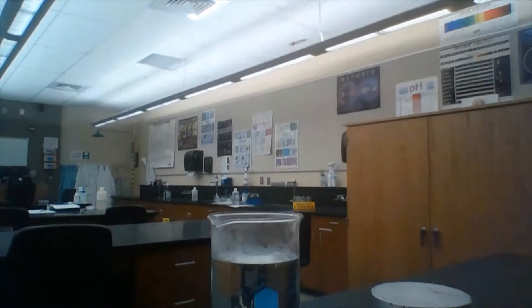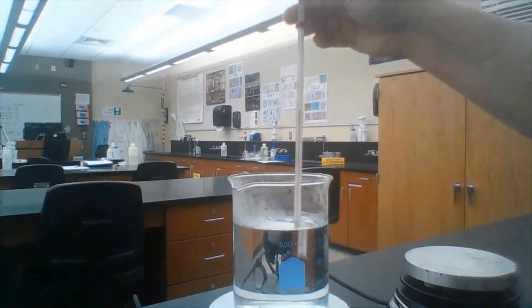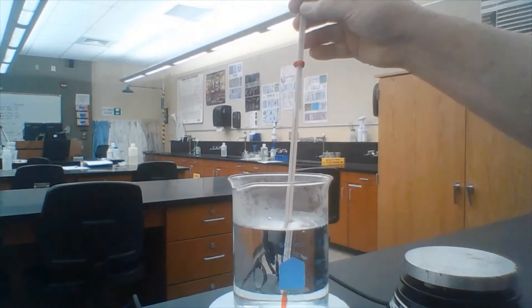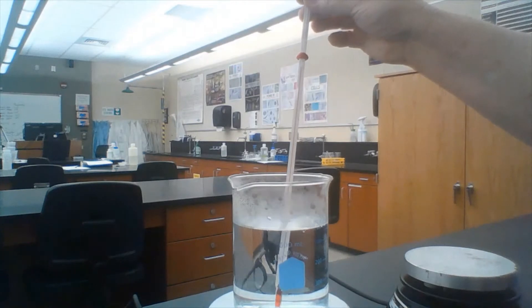The next measurement we're going to take is that of boiling water. I'm going to hold the thermometer in here, not quite touching the bottom. And you don't want to let it touch the bottom because then you're measuring the temperature of the hot plate more than the temperature of boiling water.